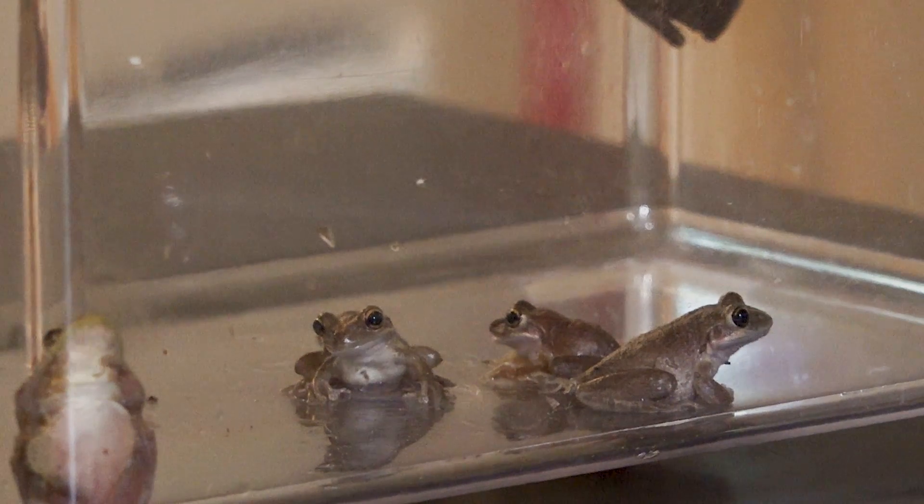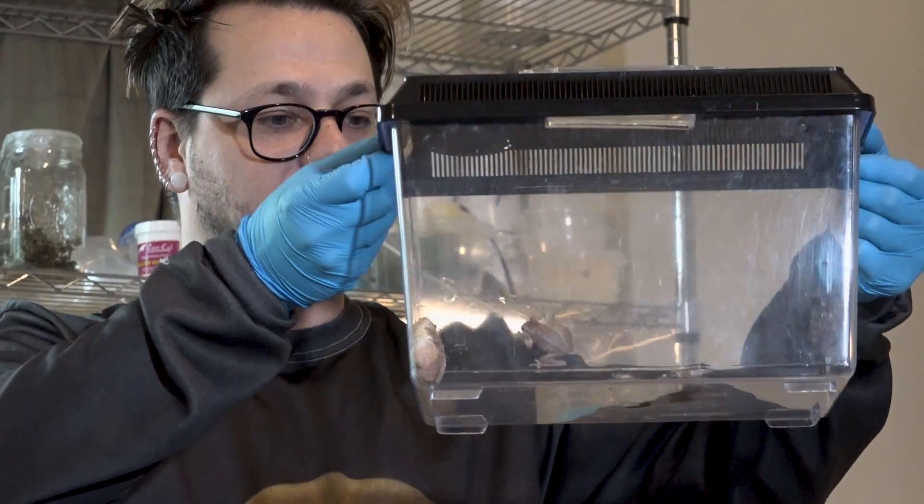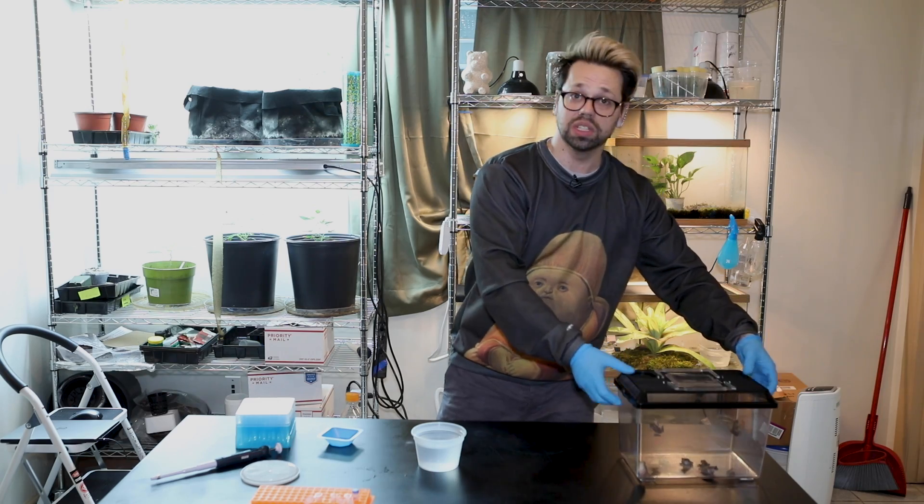And we hope that you don't create zombies. We're going to inject some of them with the gene therapy and others we're just going to leave, and we're going to see if they build up muscle and grow bigger and stronger.